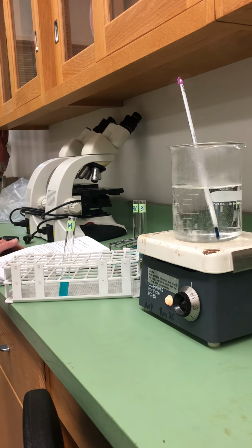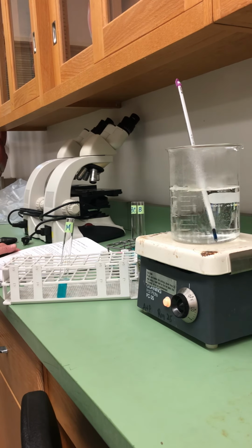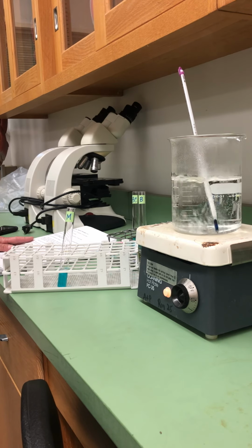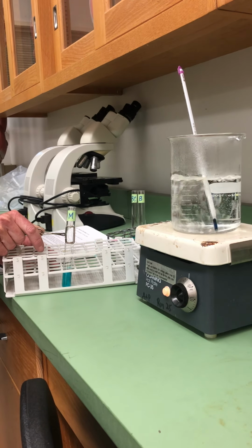We're about to perform the Benedict's test for the presence of maltose, and we're going to run this test tube containing maltose and Benedict's reagent to serve as the standard to determine if the potato starch that had amylase added broke down to maltose, which is one of the disaccharide subunits. So our standard test tube is labeled M.